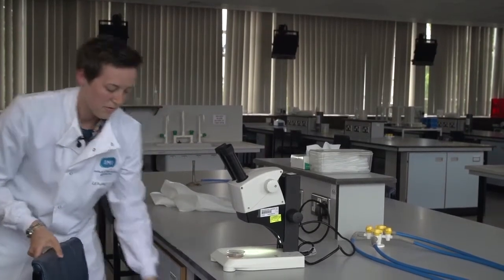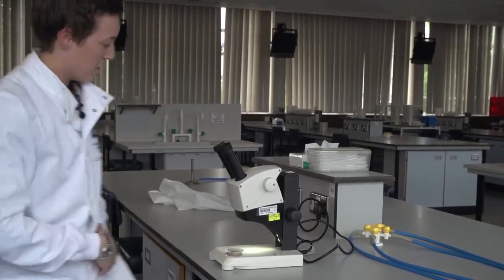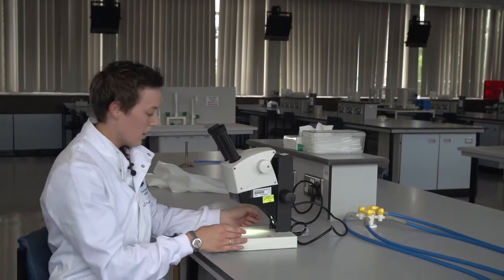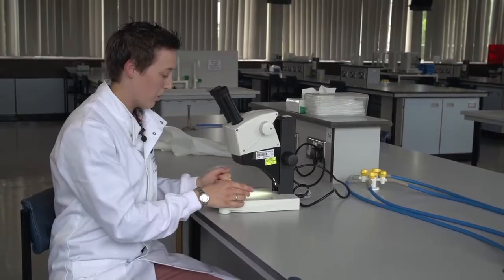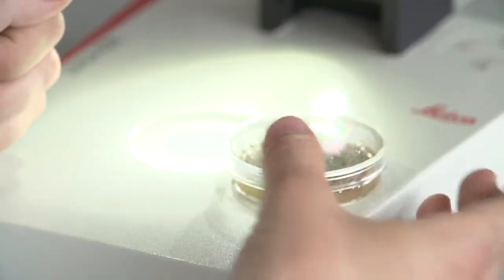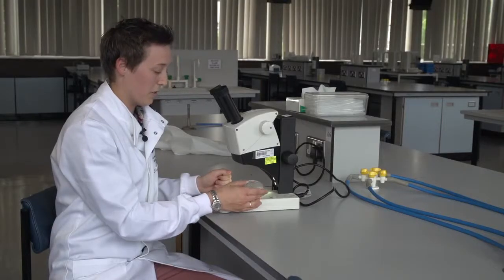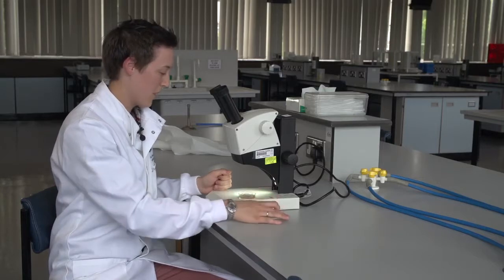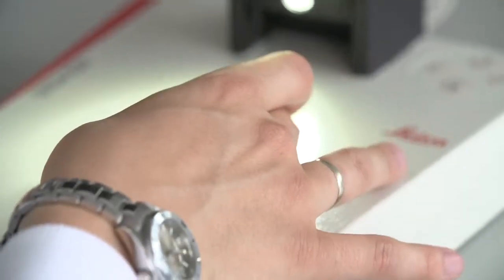So I'll just bring a chair into position. Now for this particular specimen it's not dangerous, it's not pathogenic, so I'm quite happy, and it's not forming spores at the moment so I'm happy to take the lid off so I can see the structures. I'm going to place it in the center here.